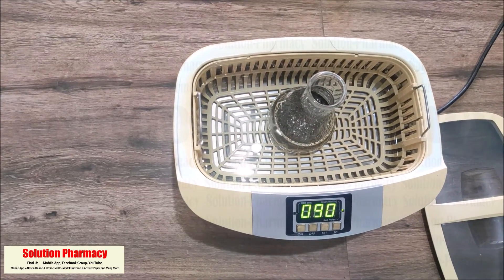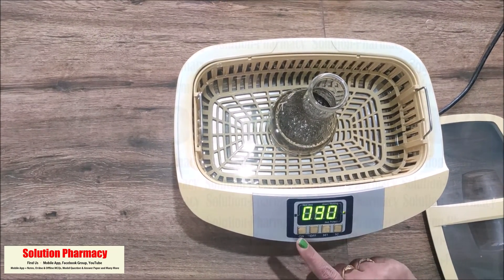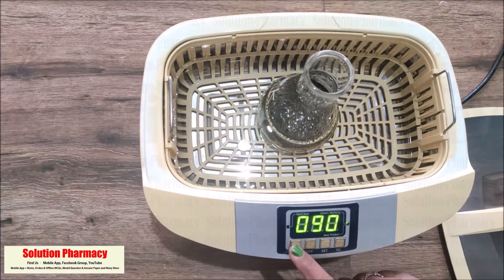The sample is the powdered plant material from which we have to perform the extraction. Here you can see we have taken powdered plant material into a conical flask, to which we have added water as a solvent for the extraction. Now place this conical flask on the basket inside the bath.